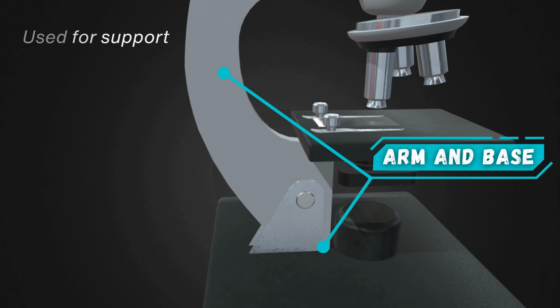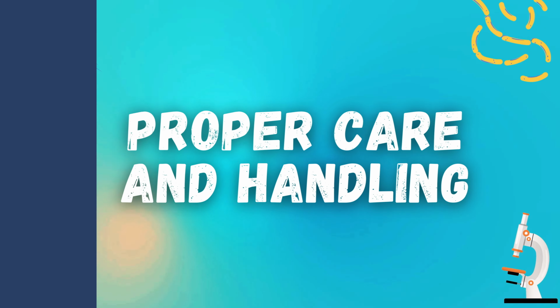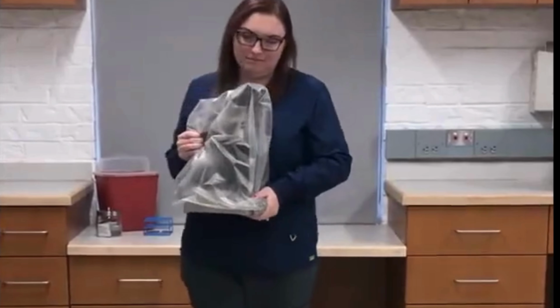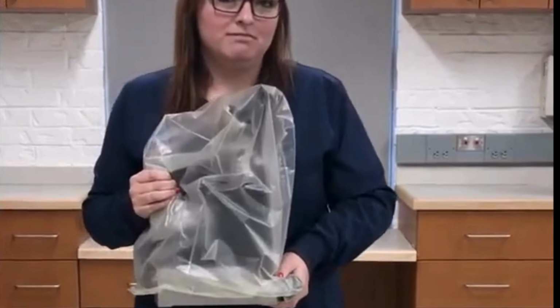And finally, the arm and base. These parts provide support and stability. Always hold a microscope by the arm and base when carrying it. Speaking of handling, let's talk about care. How do we use and take care of the microscope?